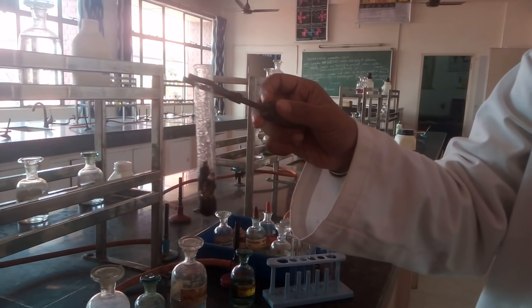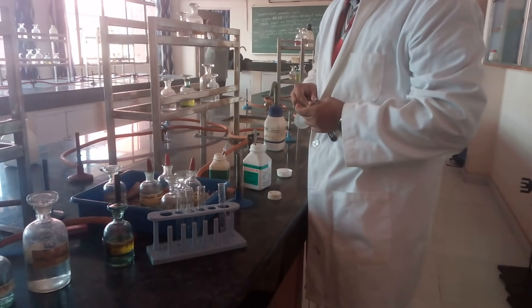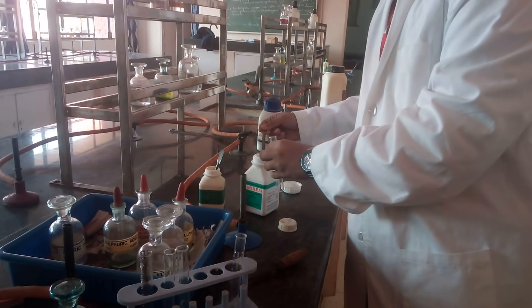This means there is absence of nitrate also. You can discard this test tube — carefully, it's hot — and use a fresh test tube for sulphate. For the sulphate test, you will not be requiring the dry salt because we are not testing gas anymore. You will be requiring an original solution, which you can prepare by taking a small pinch of salt and adding water.